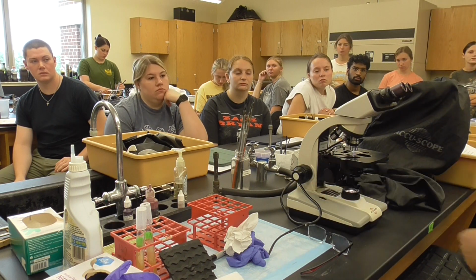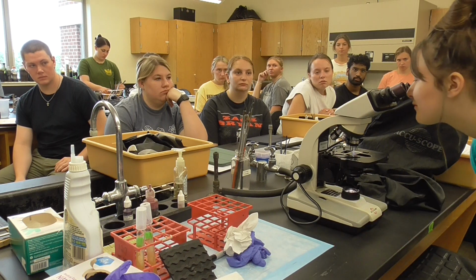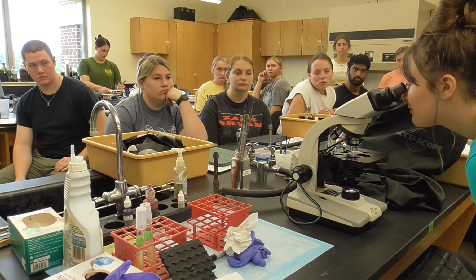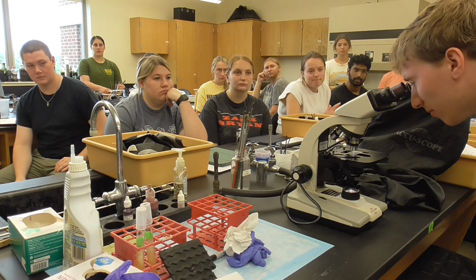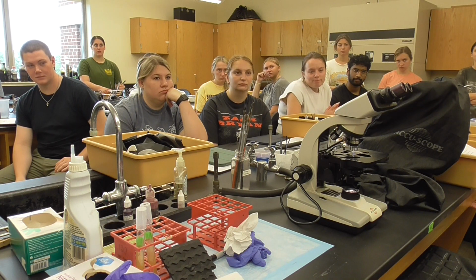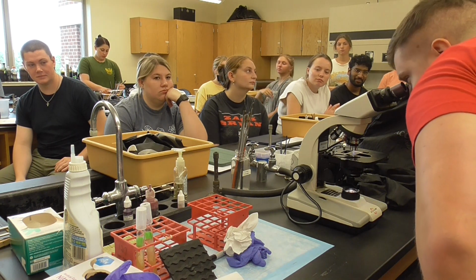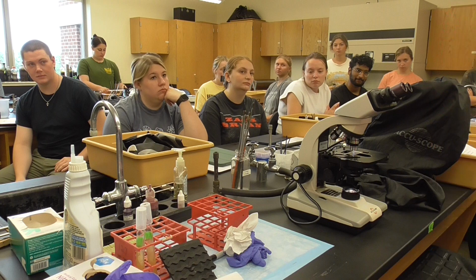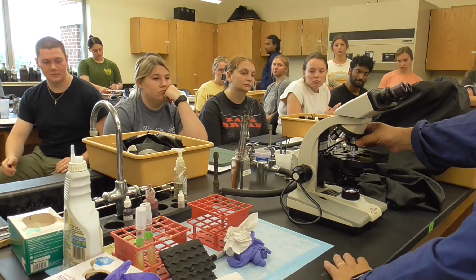So I just want to have one student come to see it. You will see a lot of that. Can you see that? Can you go ahead and see it? That's a lot of the single dots, but you're not going to see anything. Can you go ahead and see it? That's what the sample looks like when you find it. Okay, when you find the sample, we're going to switch to 100x.